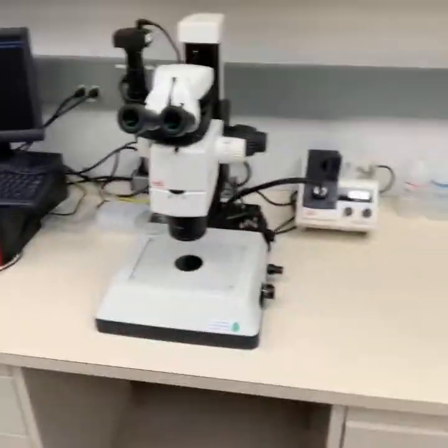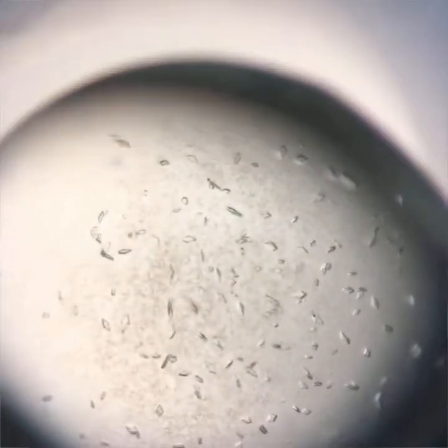Let me show you a picture of what we're aiming for. This sample actually has more crystals than I'd want — it would be hard to fish them out. It's usually better to have fewer, bigger crystals. This was one of the first crystals I got early on and I was really excited. When you're looking under the microscope at the plate, you can actually see the different layers of the protein.